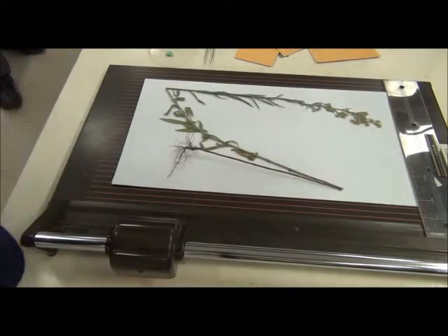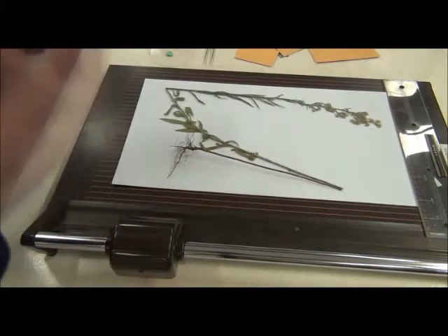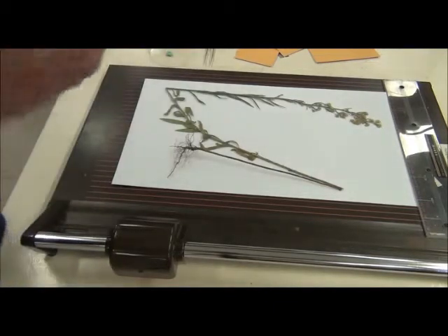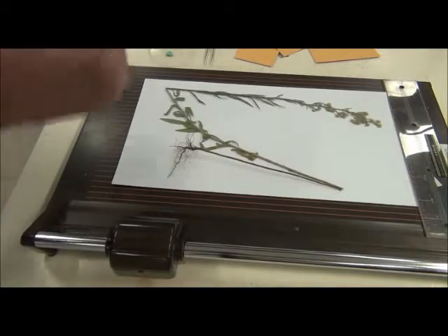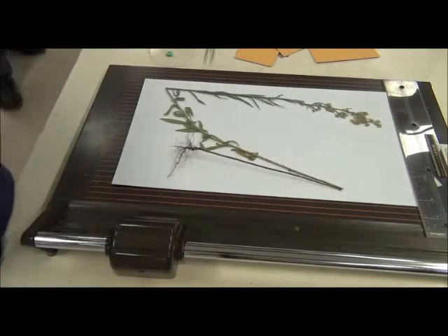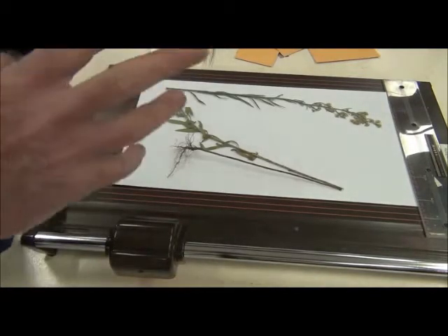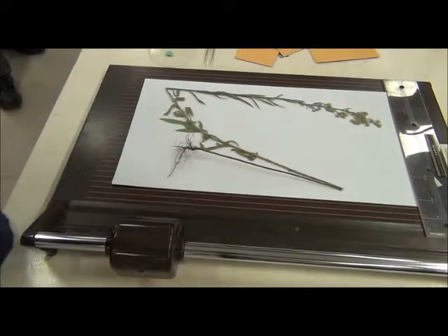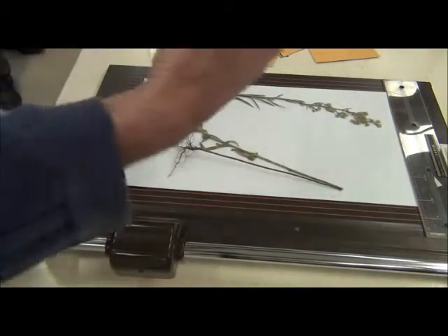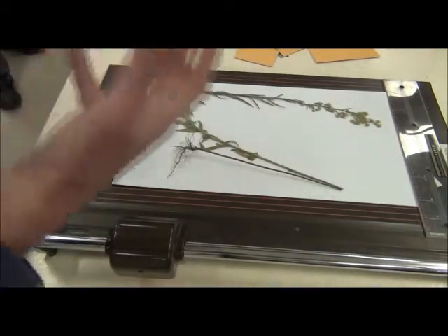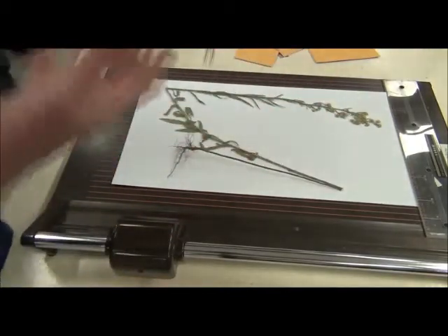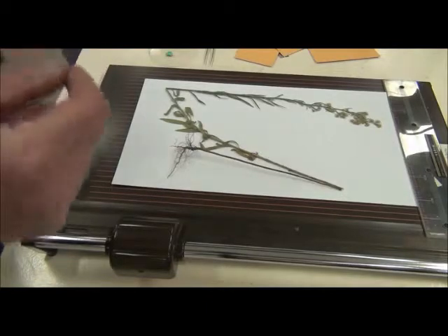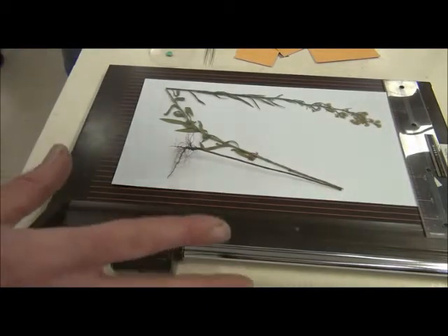The advantage on this over what some herbaria around the world still do, which is to glue with archival quality wood glue, is that with the glue you've stuck the specimen down and you can't get it off easily. That's exactly what some herbaria want to do, but herbaria that are thinking about the users, the researchers, will want to make it so that the specimens can be removed or can be moved and bits can be removed with expressed permission.